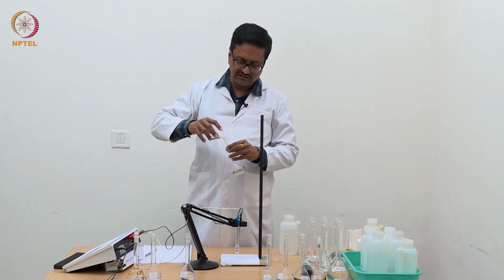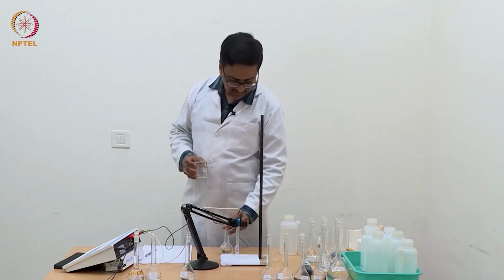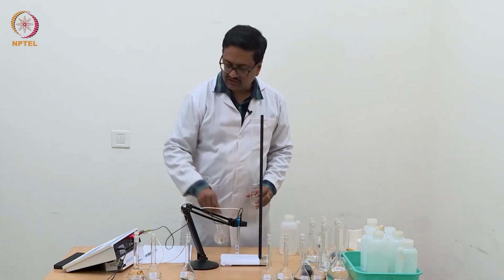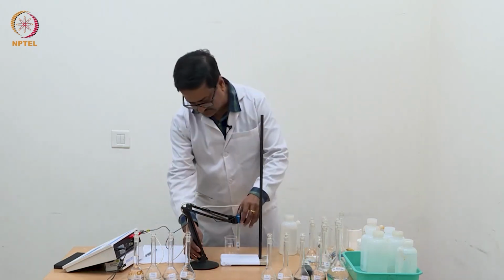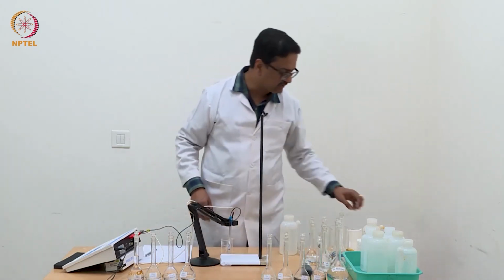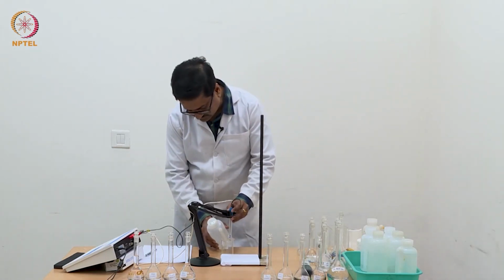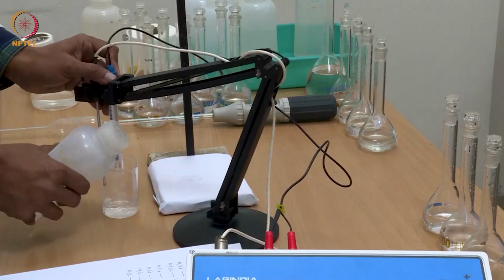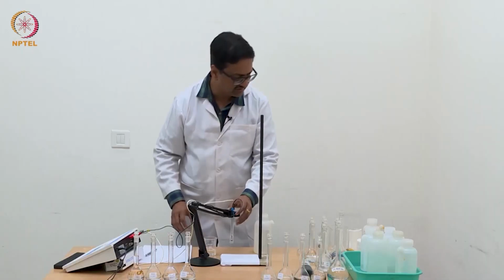The degree of dissociation of acetic acid is dependent on the concentration, and as a result the eventual conductance is different for increase in concentration by 2 times compared to HCl. So when we plot, we will be able to see the actual difference in these two sets of experiments.